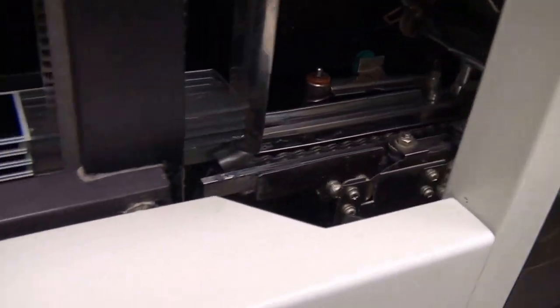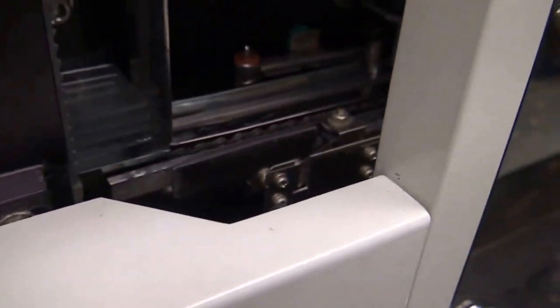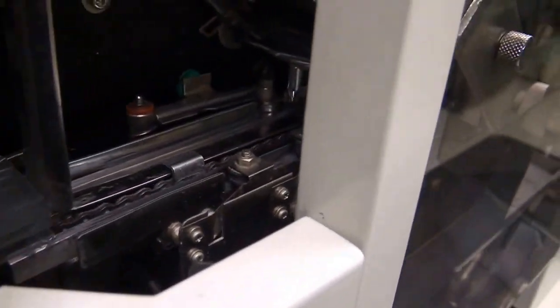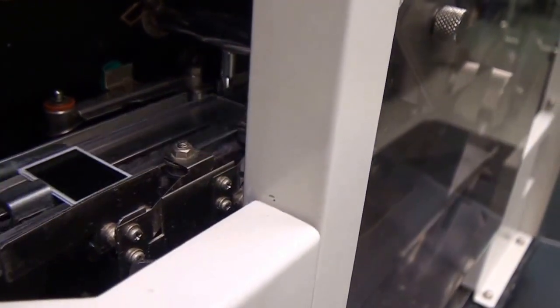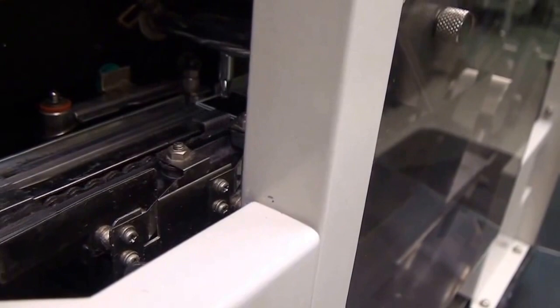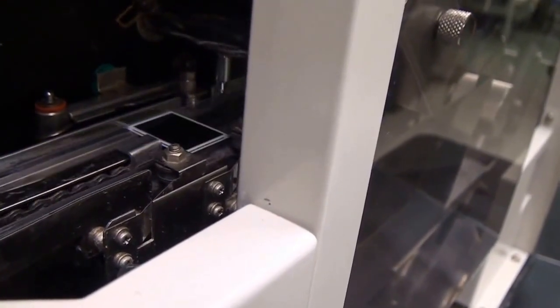And you can see the slides here will be pushed out and then mix it on in there. You can see it drips really nice on the slide there as it comes across. It works really good.